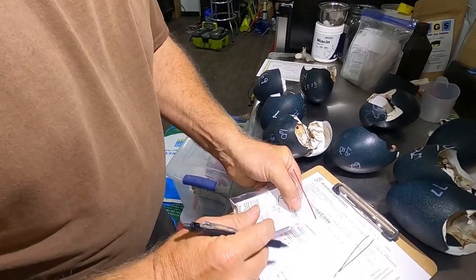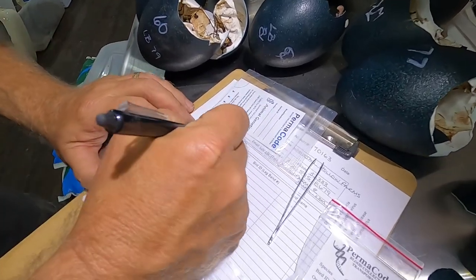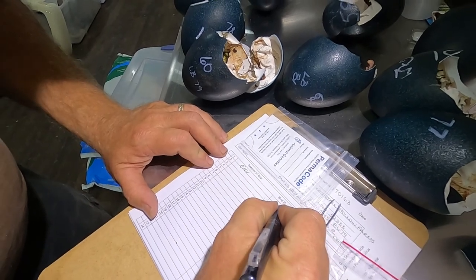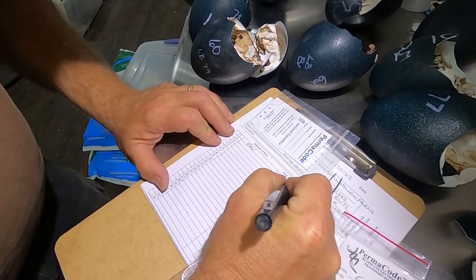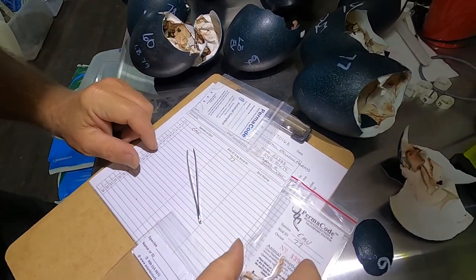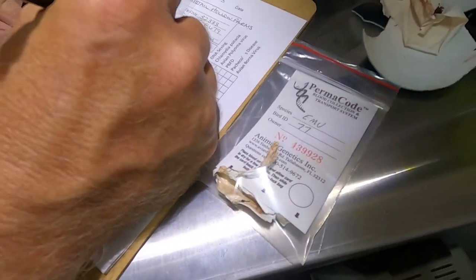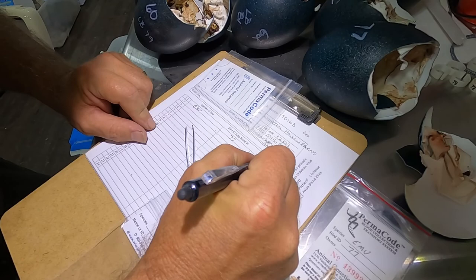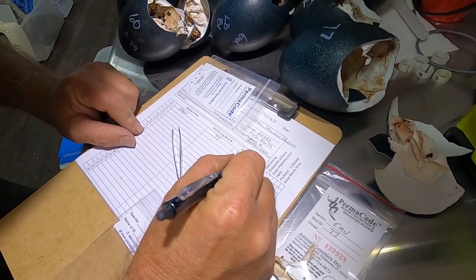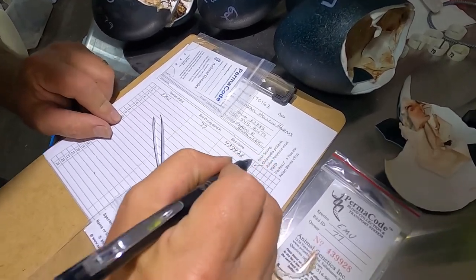You can also put your farm name or whatever you'd like at the bottom. I record emu, leg band number 77, and put the bird name down along with the label number — so that's 439928 — and I put a check mark for DNA sexing.